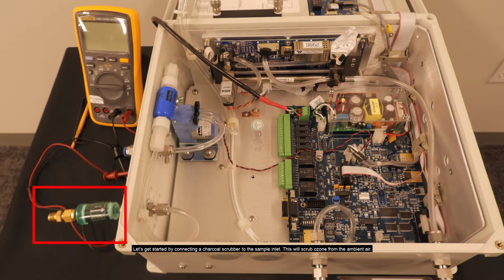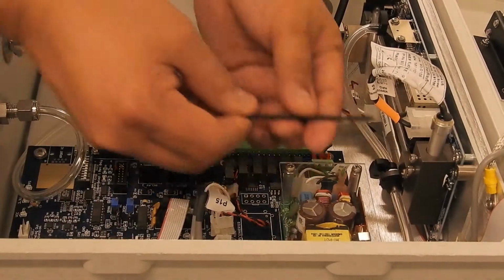Let's get started by connecting a charcoal scrubber to the sample inlet. This will scrub ozone from the ambient air. Open the cover and locate the lamp.